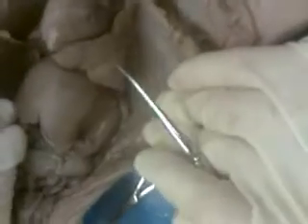All right, now see, that's inferior vena cava there. Where? Right here. See, it's closer to the anterior side, whereas the aorta is toward the back, more dorsal. And those pink things that are right there, that's what you were talking about, the intercostal vein, right? Mm-hmm. Now, let's see, one other little thing, too.